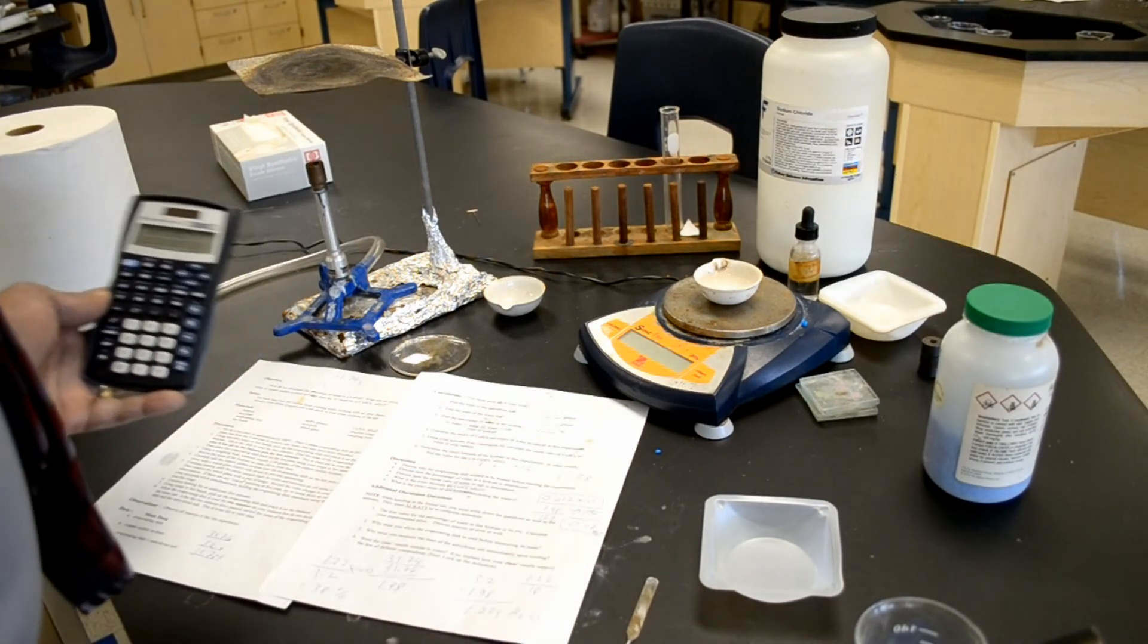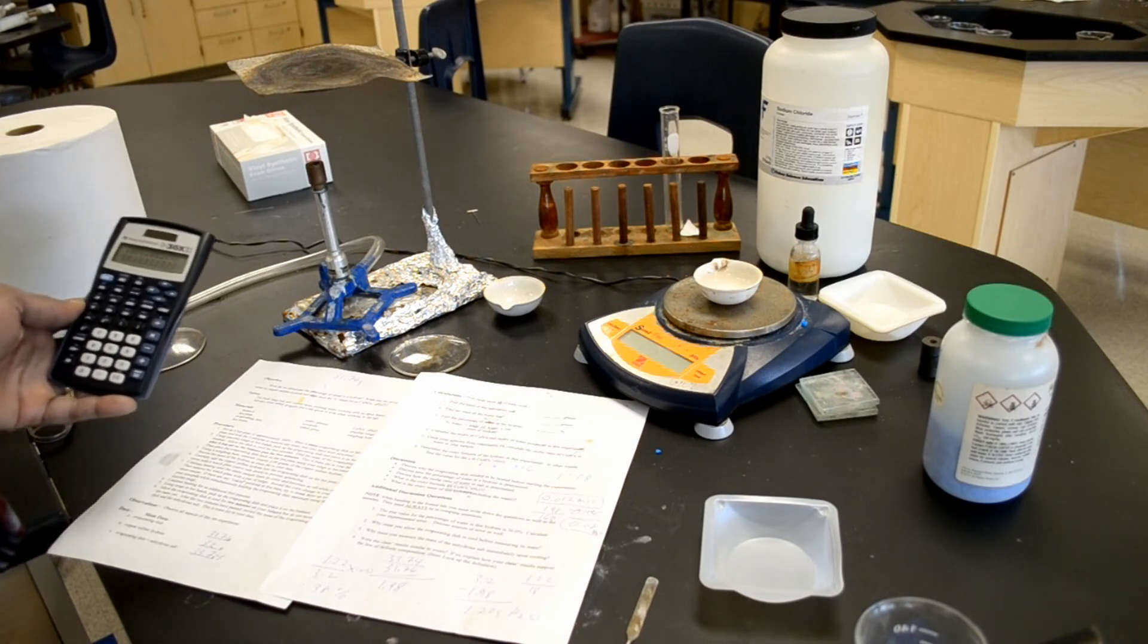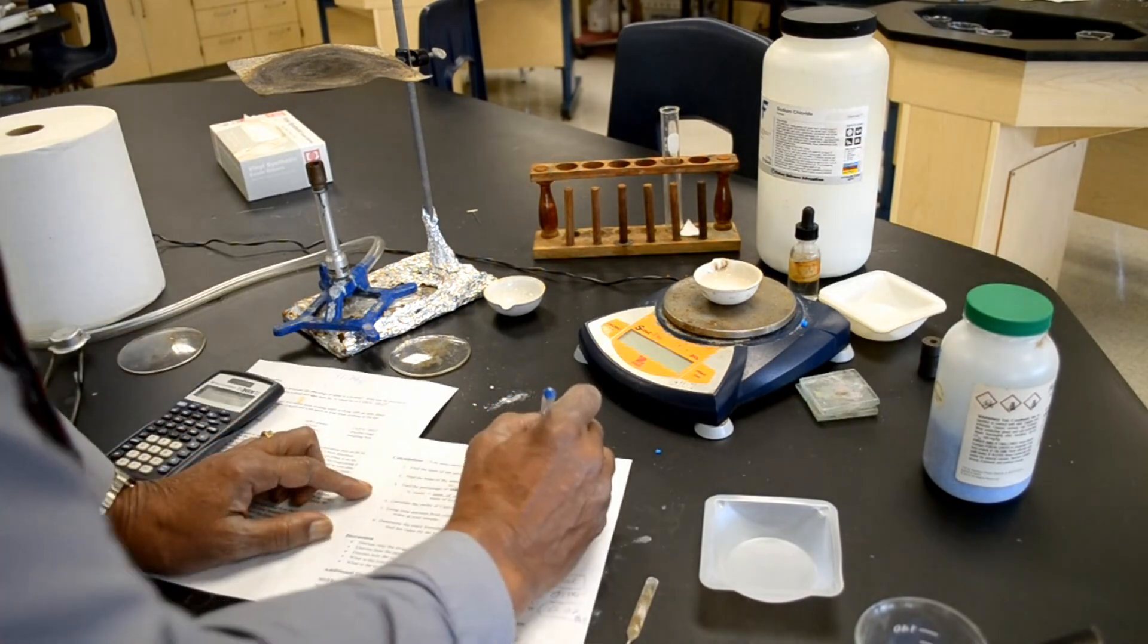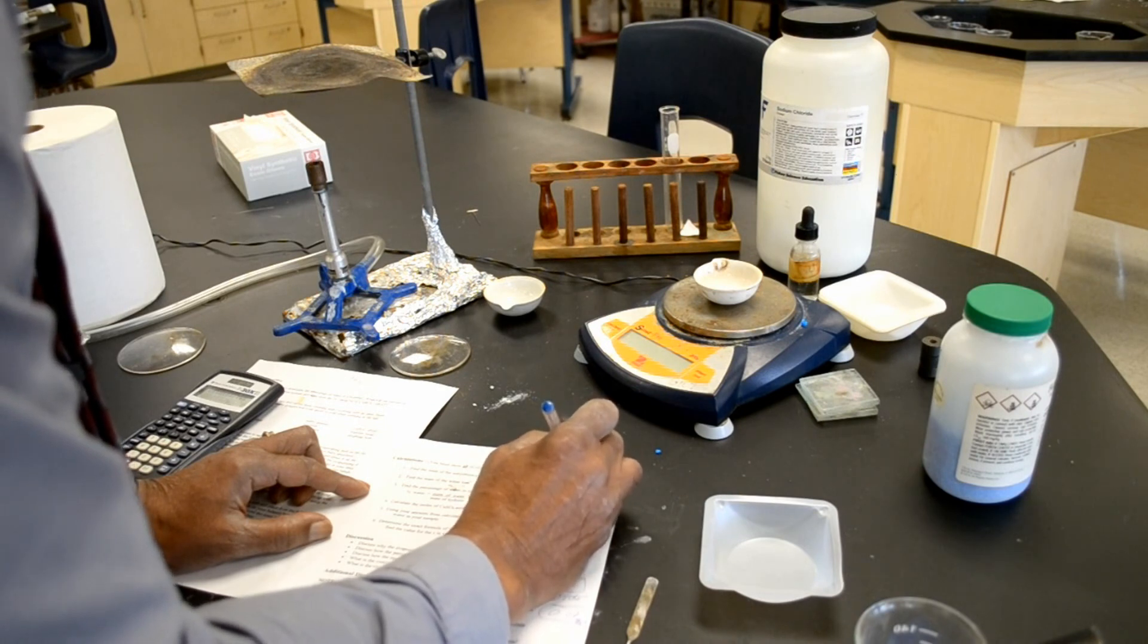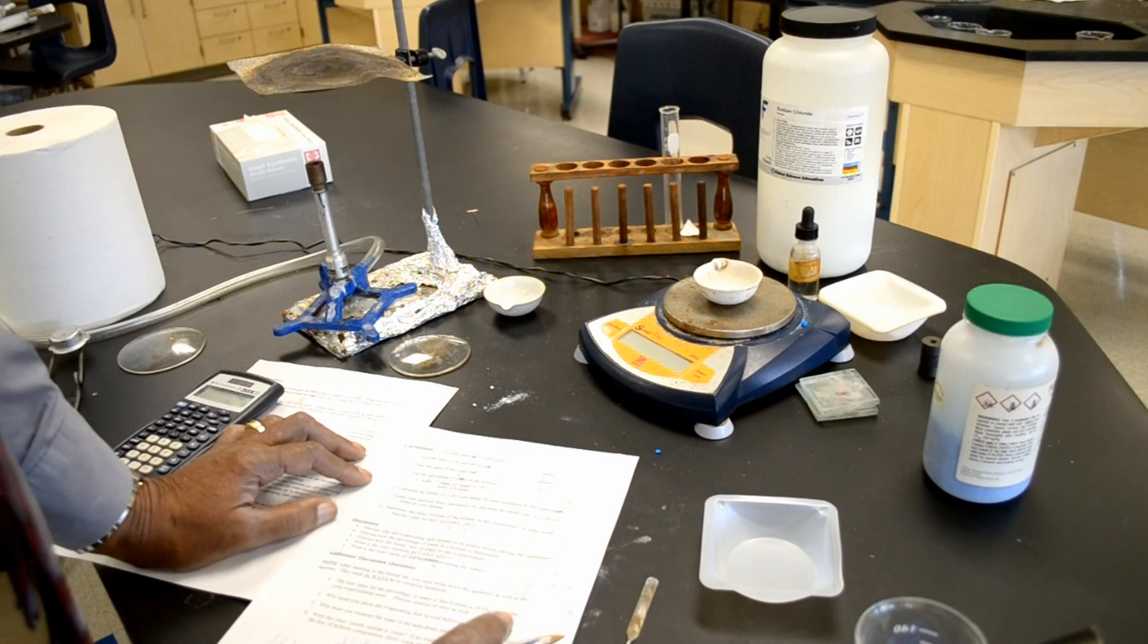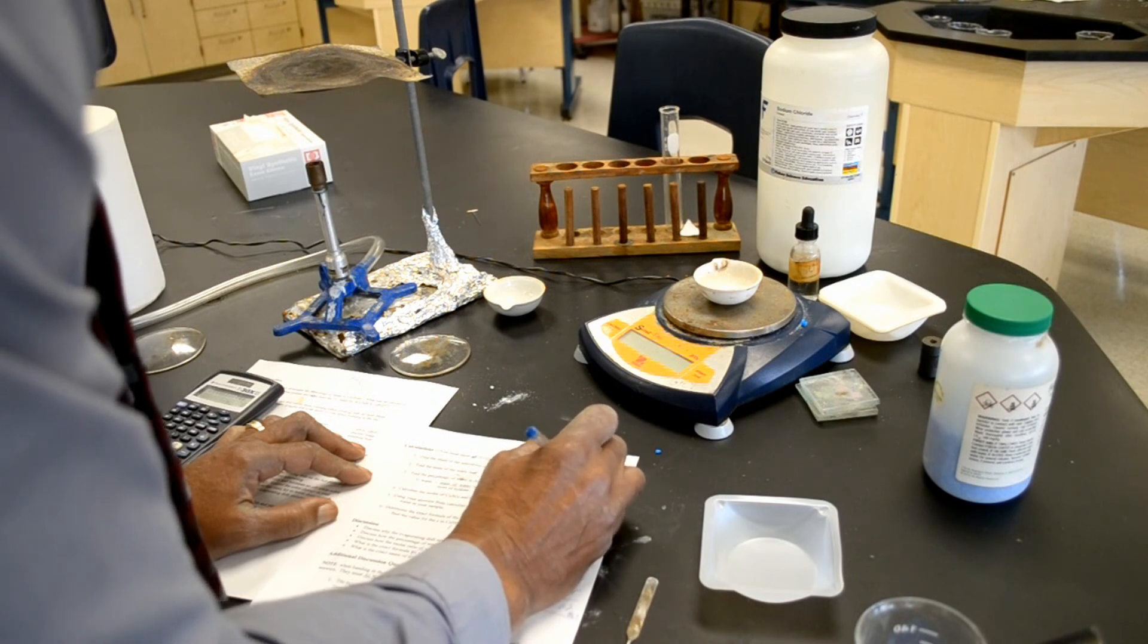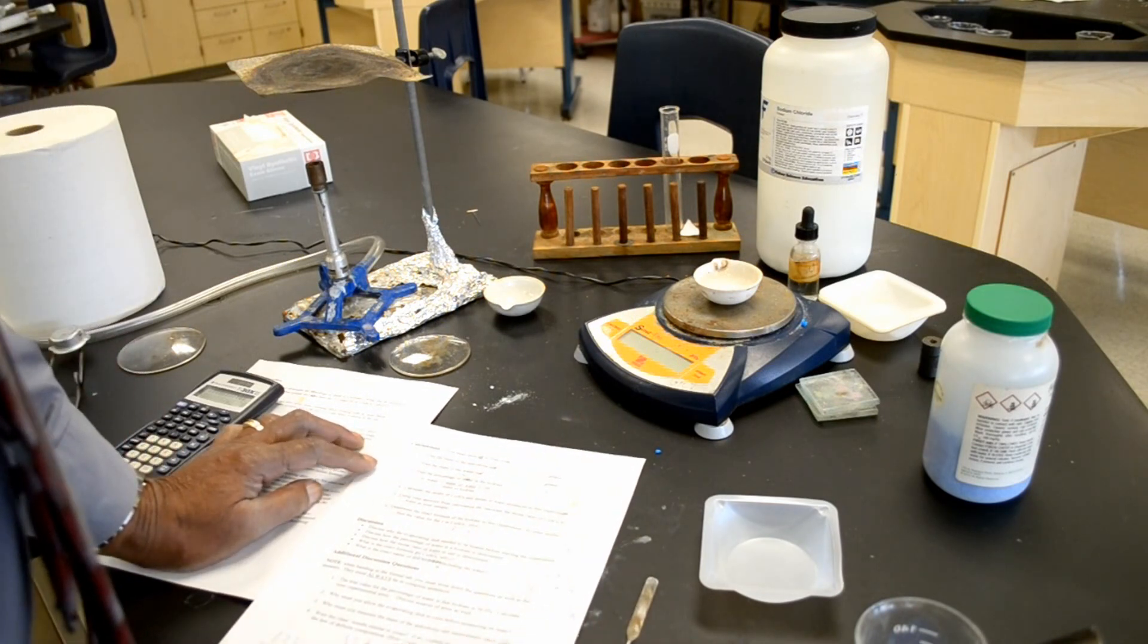But as we very well know, the X was actually 5. A little error there. At any rate, we found that the formula is CUSO4·6H2O, which is called copper sulfate hexahydrate, but it should be CUSO4·5H2O, which is copper sulfate pentahydrate.